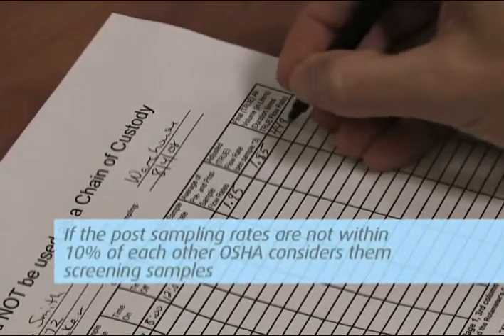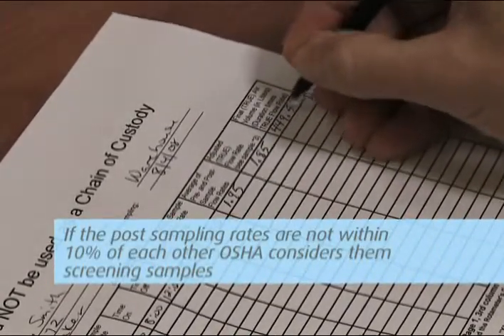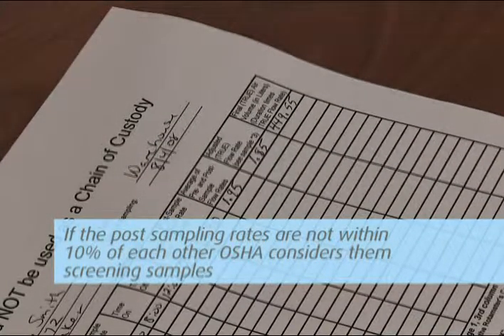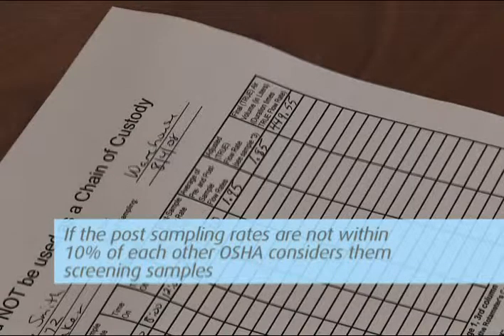If the post-sampling rates are not within 10%, OSHA considers the samples screening samples. And if the analytical results show high levels, resampling is recommended.